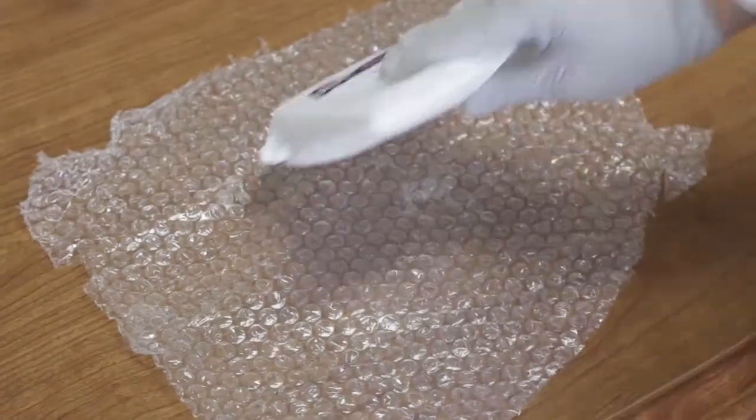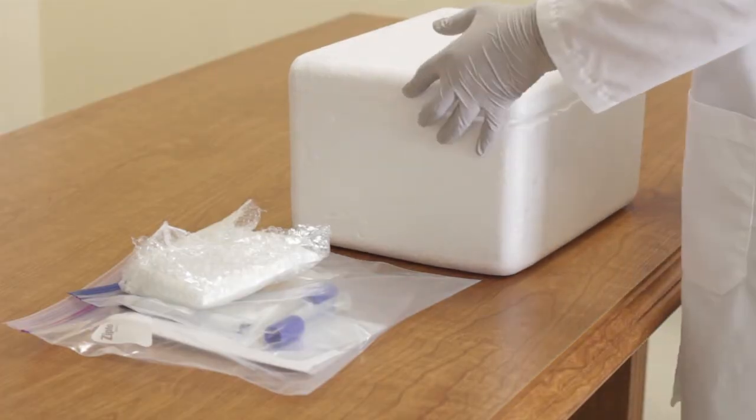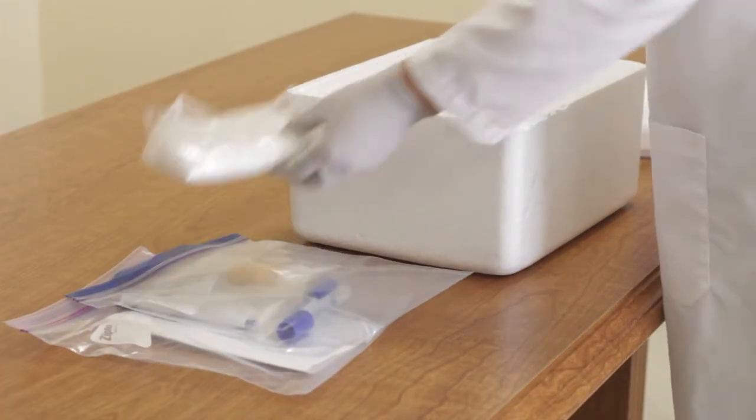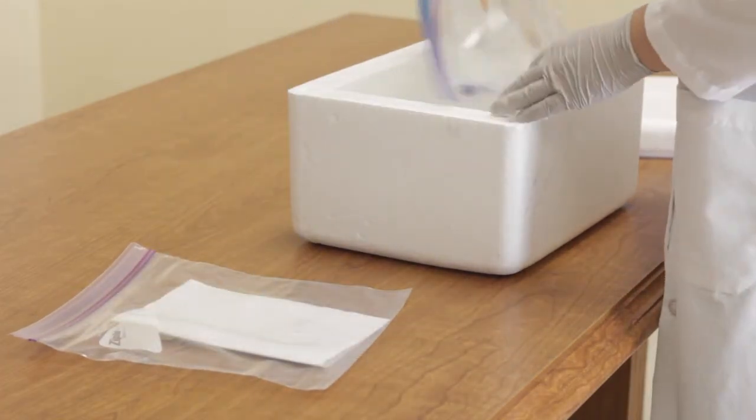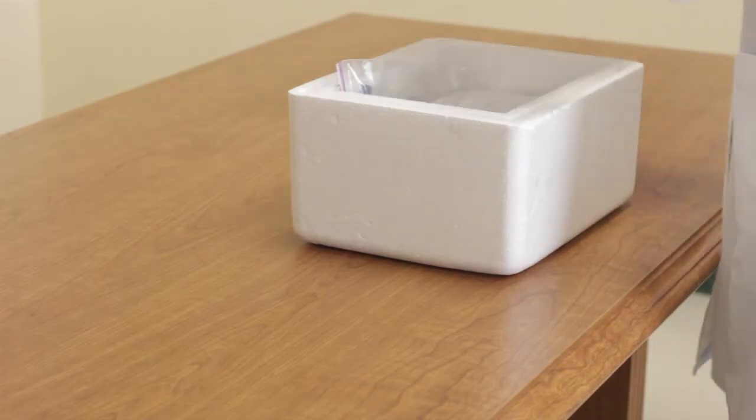Pack the samples in a secure way to avoid damage. Keep the samples cool but not frozen by using an insulated cooler with ice packs. Do not use ice or dry ice. Submit samples within holding time and remember to always include a sample submission form or chain of custody form in the package.